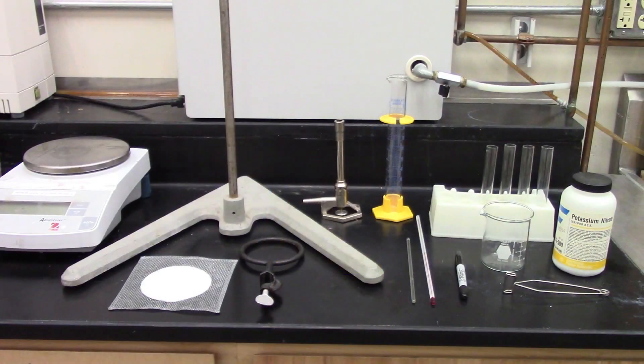In this laboratory exercise, we will be analyzing the solubility of potassium nitrate in water at different temperatures.